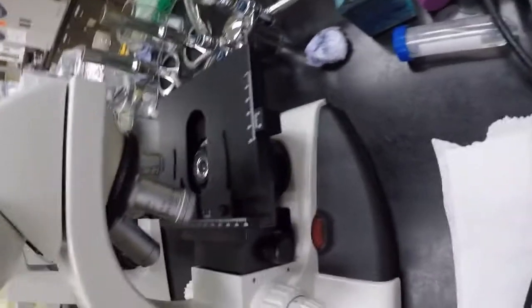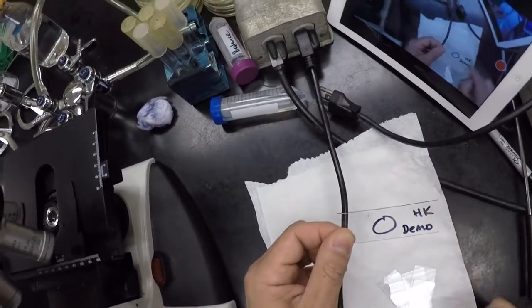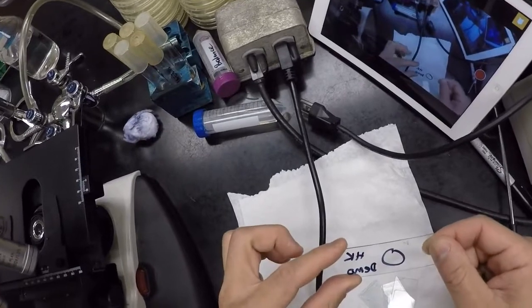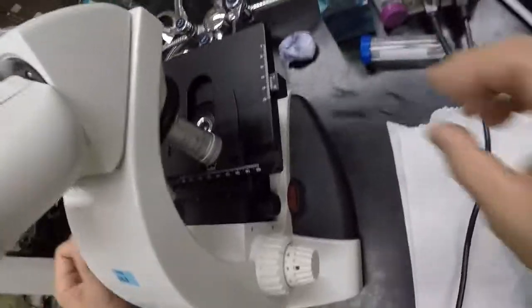Okay, so let's look at basic operation. Here's my slide, my smear, right? And we talked about how to make a smear. There are my labels, right? And remember, my sample's actually on the other side, right? So I'm going to flip this over. And I want to look at backwards labels so that I know my sample side is up. Because ultimately, that's what we want, right?